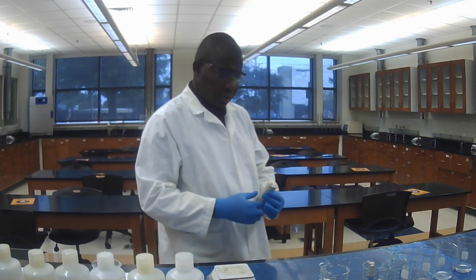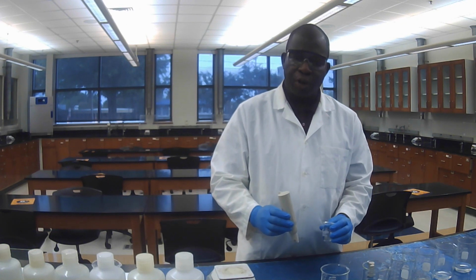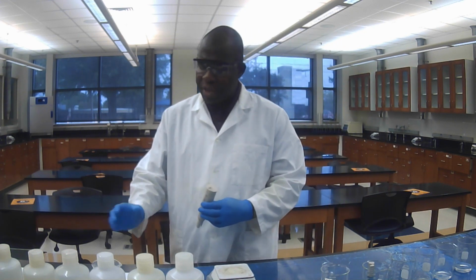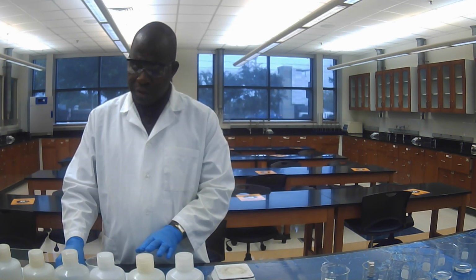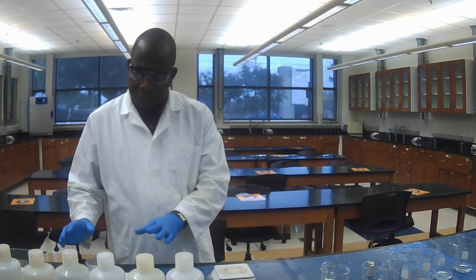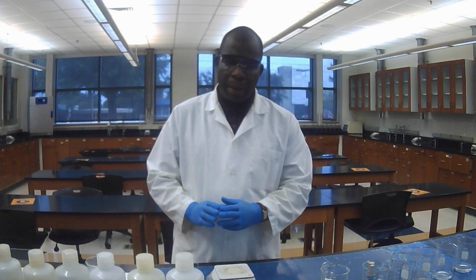Now after I take the pH of the unboiled water, I'm going to take the pH of the boiled water. My boiled water is still cooling down, so I have to wait. After it cools down, I will take the pH and write the result in my lab book.